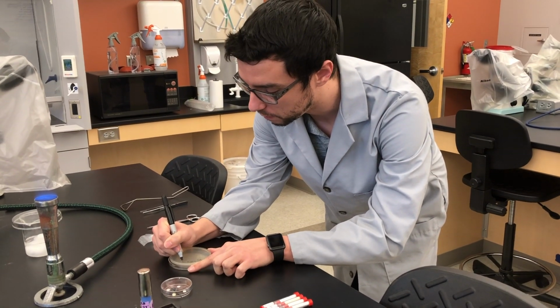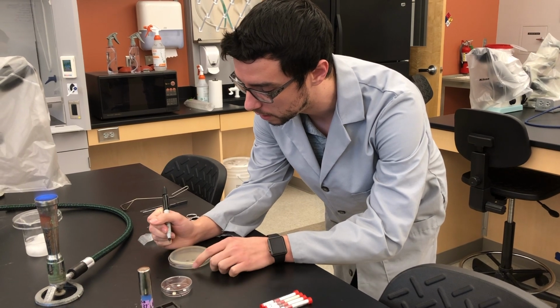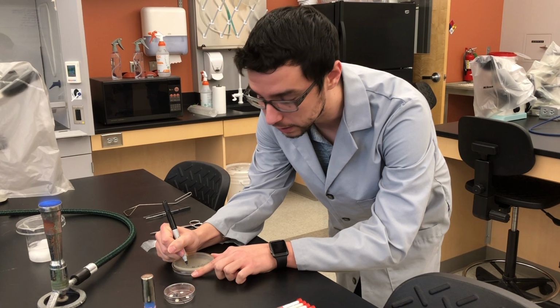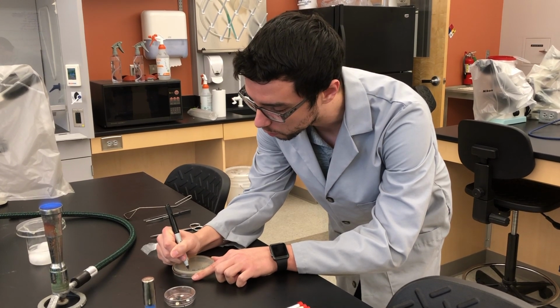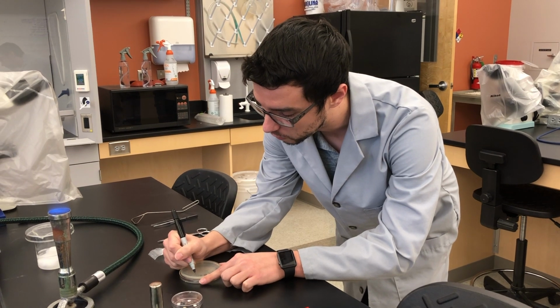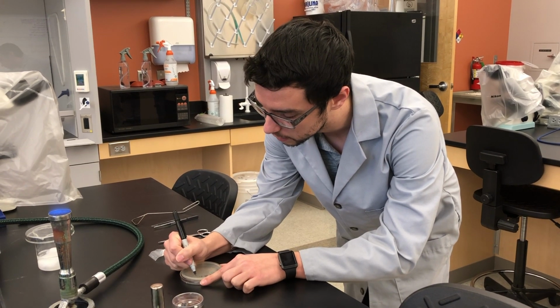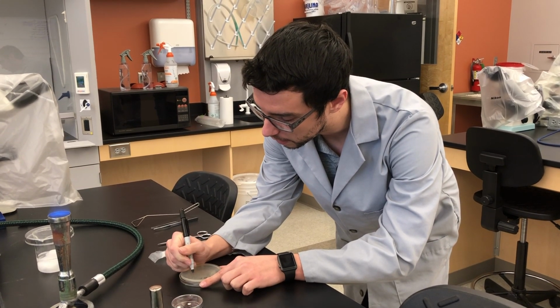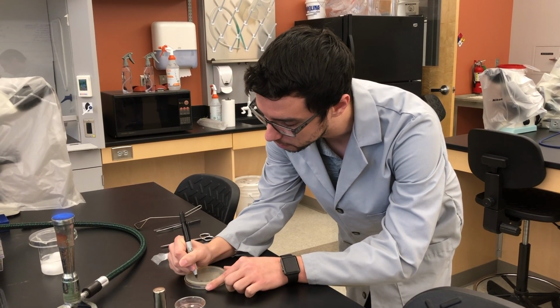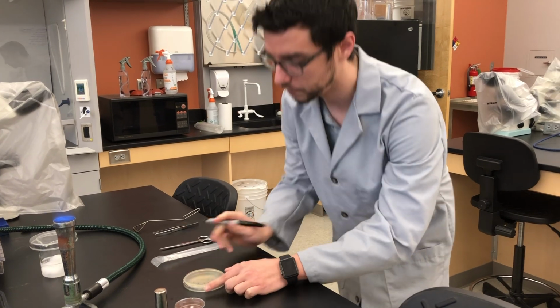It's a media type that we like to use for antibiotic sensitivity tests. For this video, we're working with E. coli, so EC, and then we're also growing this at 37 degrees, and then your lab ID, whatever that may be. All right?